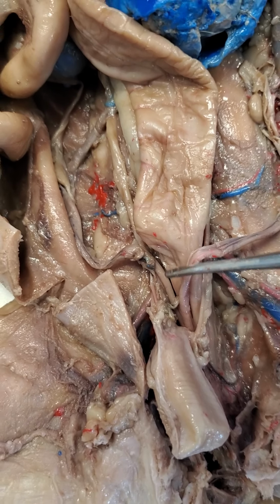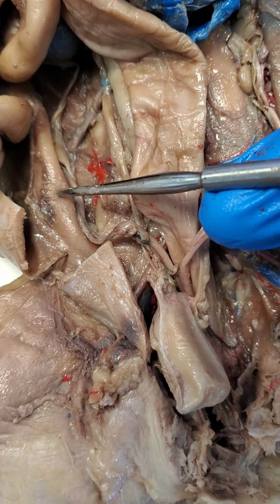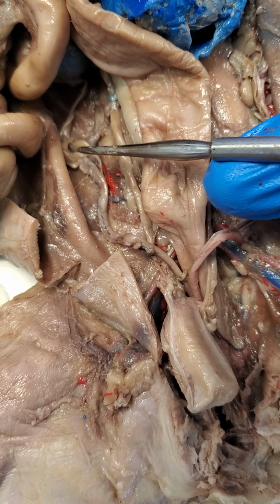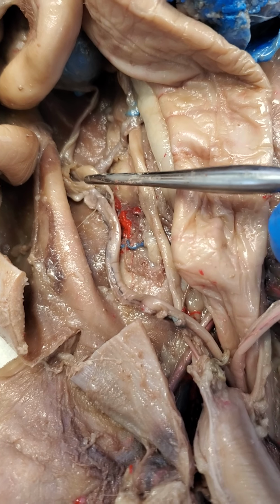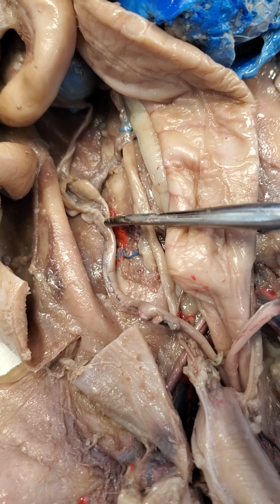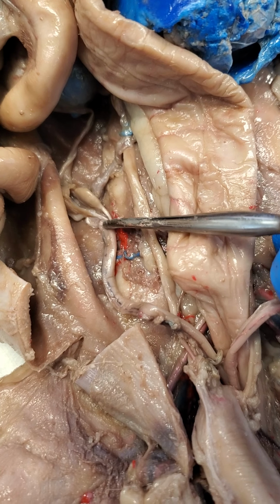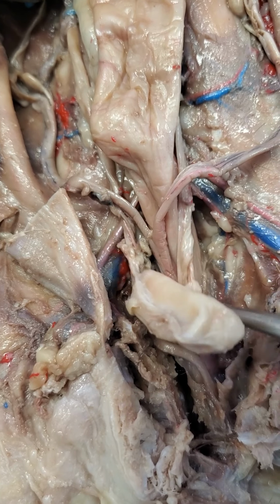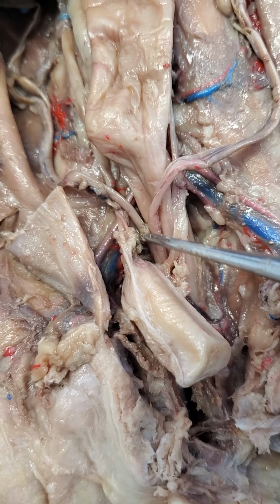All right. And if we look at the other side, we can also see a similar structure. So this right here is another uterine horn. And as you can see, we can follow that to the end where we see our ovary right there. All right, and then our fallopian tube is actually sitting just behind the ovary. So you can see that there's a little bit of what might look like a tube right here. That's just a ligament that's holding the ovary to that uterine horn. All right, so there's a fallopian tube that goes right around the back here. Uterine horn going down. And where the two uterine horns meet, you can see right here is where they start to meet. This is all called the uterine body.